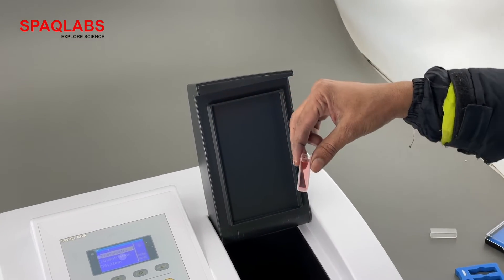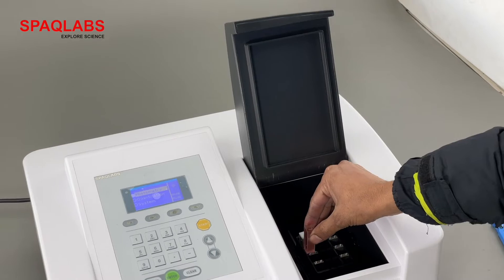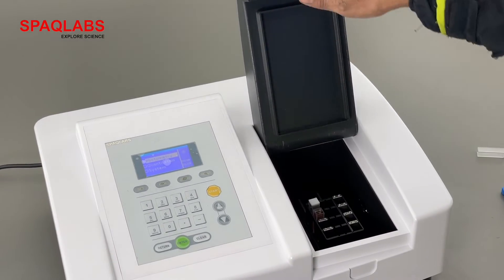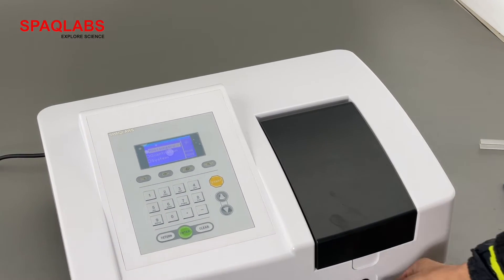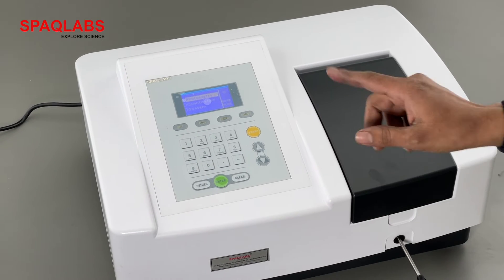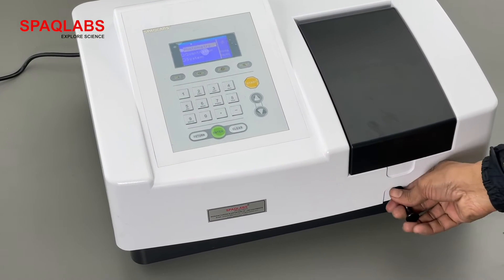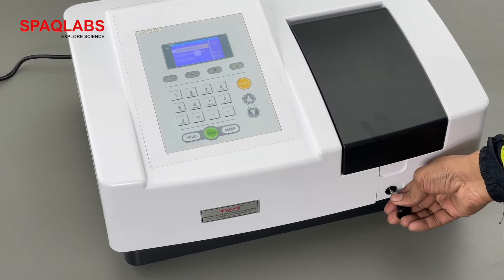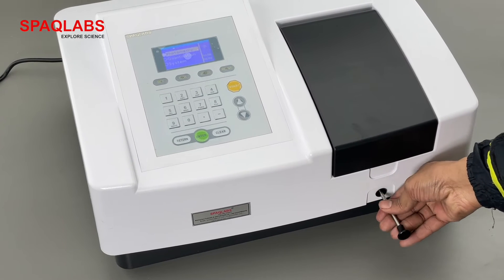This is the sample we are testing — it has cobalt chloride inside. We place it with the clear side here in the second position. Now we are closing the chamber. This lever is used to select cuvettes one, two, three, and four — we have four cuvette selections.